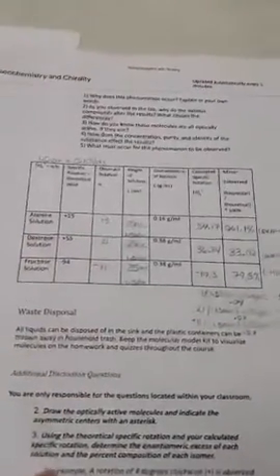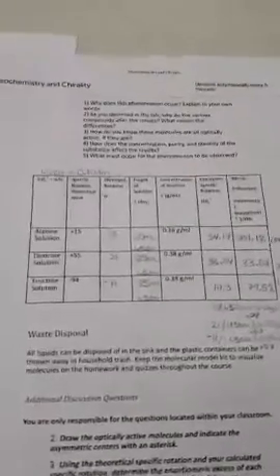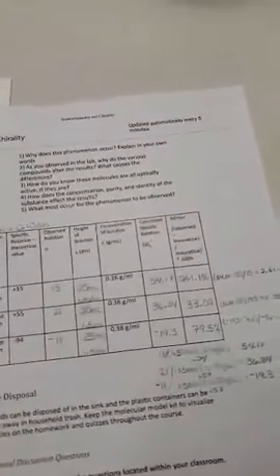So you can still see through it at the 0 mark, so you have to literally physically move the second film to get a different angle, which gives us the observed rotation: how much I had to move the film to be able to have it completely blacked out.